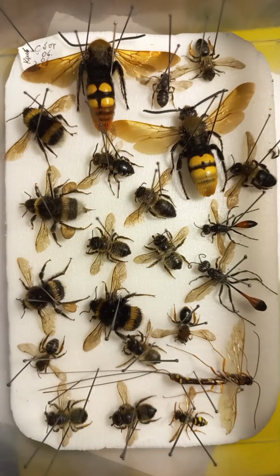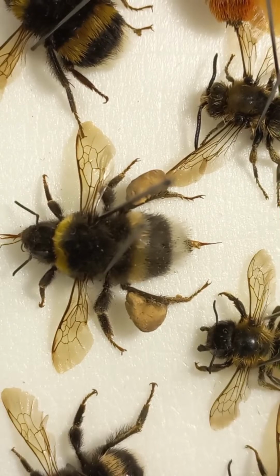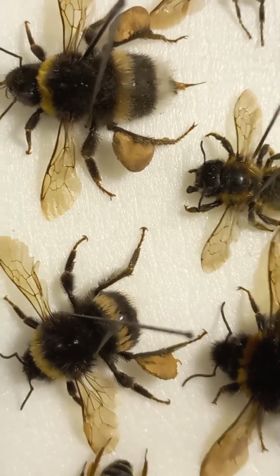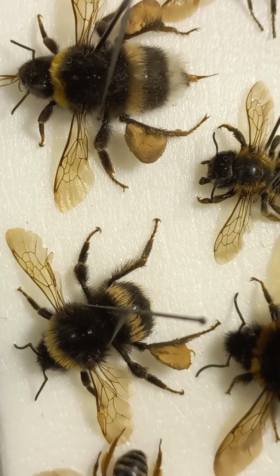And here in this final container, I'm pleased to show a small collection of different wasps and bees, and bumblebees as well. In the central part you can recognize 1, 2, 3, 4 workers of bumblebees. One bumblebee with pollen pellets, pollen collected on pollen baskets attached to the hind legs. 2 big pieces of pollen. This is a worker with extended sting. Sorry about the collection, but this is for education. This one lost a piece of pollen, and these are workers.